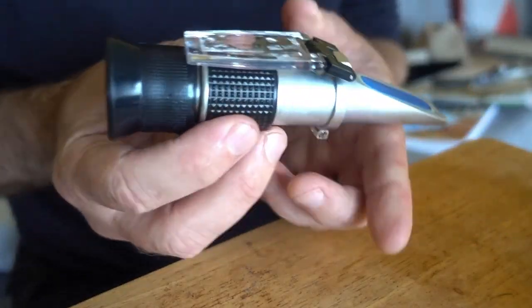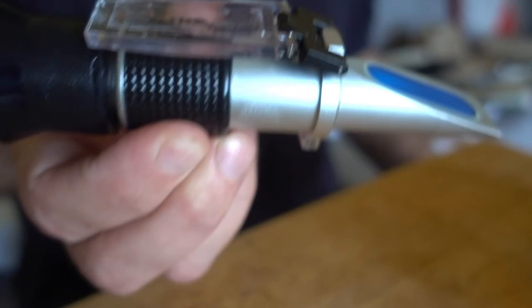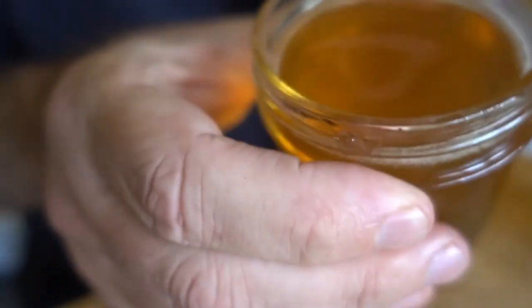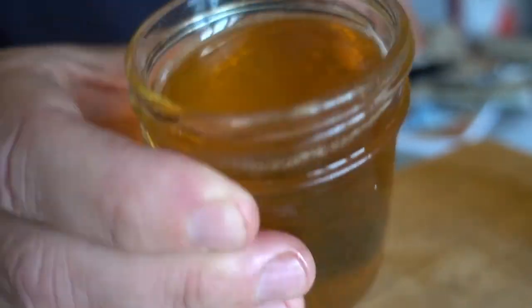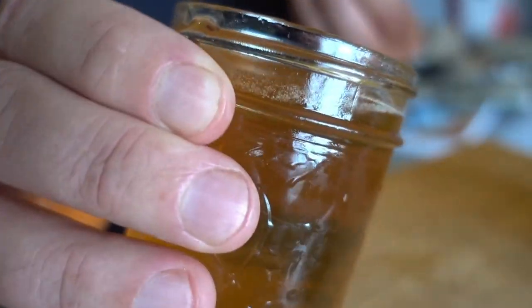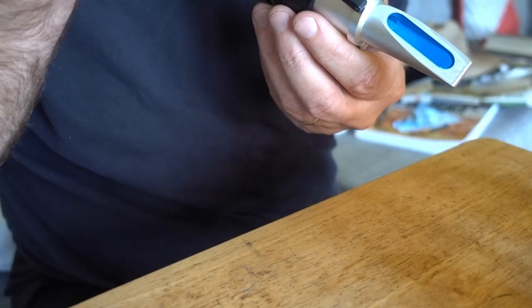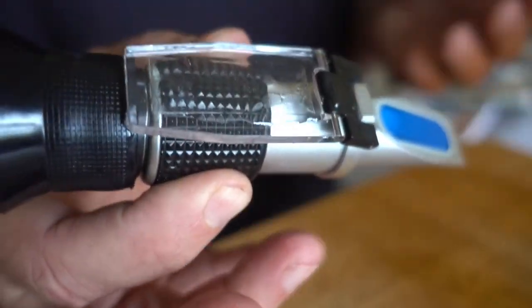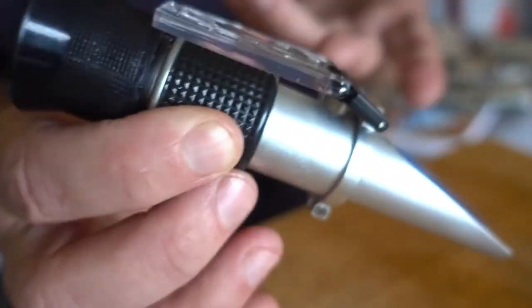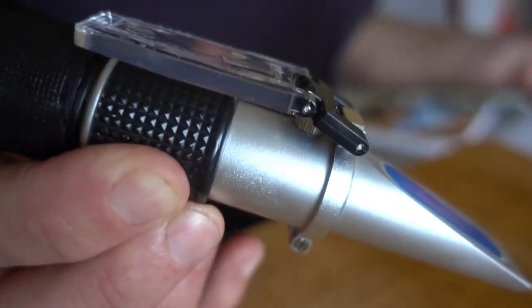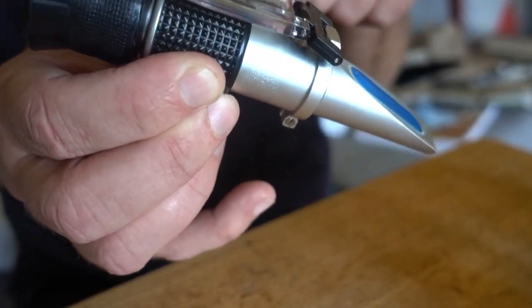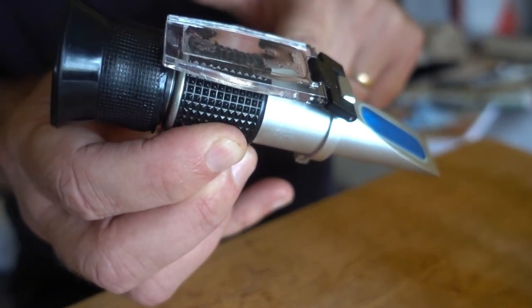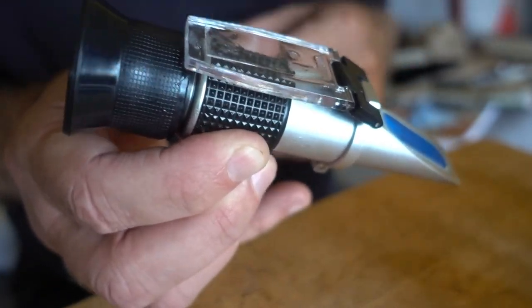So anyway I still think I'm pretty much in the ballpark here. What I'm surprised by is the fact that the honey that I thought wasn't fully cured is actually pretty cured, good to know. Unless of course this is a hunk of junk and it's not giving me any kind of accurate reading at all, but I still think it's pretty much in the ballpark and as long as I can get that number down to say 18, 17 for sure, I think we're good.